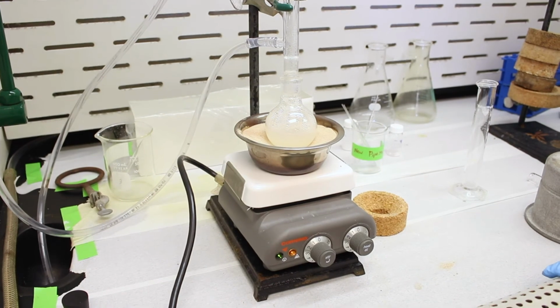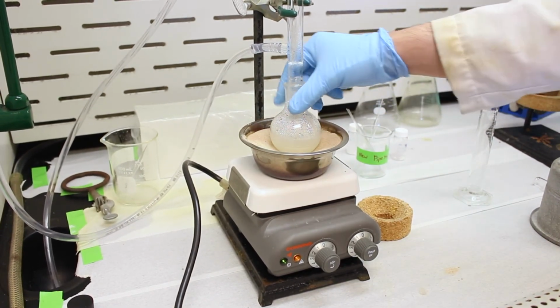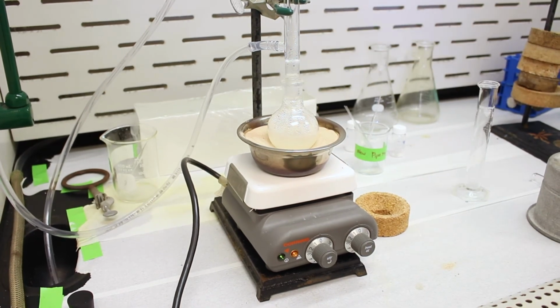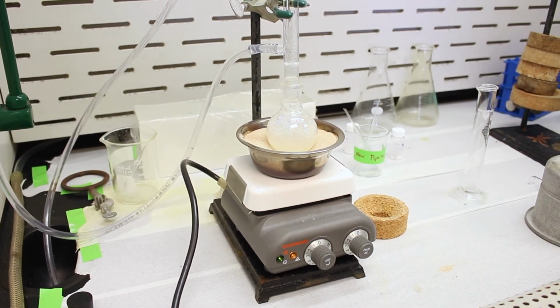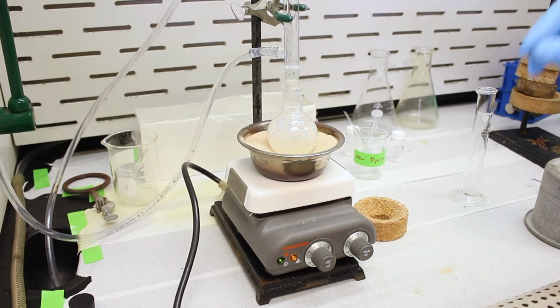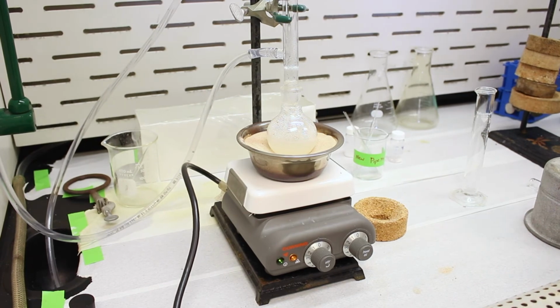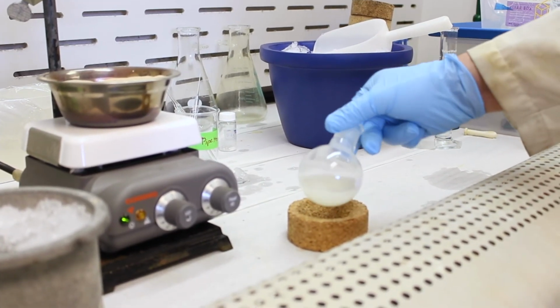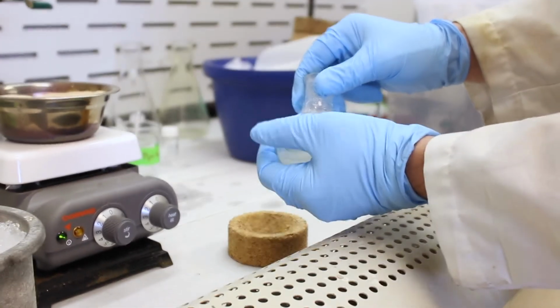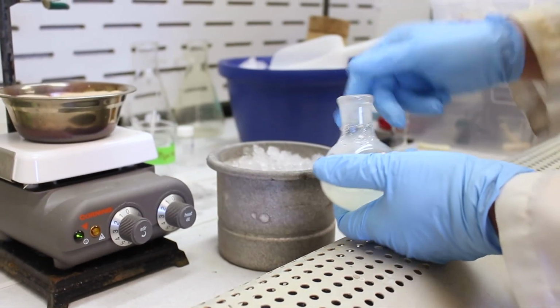Okay, so we've refluxed this reaction for an hour, and now I've lifted it out of the sand bath so it doesn't heat it. Now we're going to let it cool to room temperature, and then afterwards we're going to place the flask into an ice bath to try to get as much of the product to solidify as possible. Okay, alright, so we've allowed our reaction mixture to cool to room temperature. The flask is just mildly warm. Okay, so now it's safe to be placed into our ice bath.